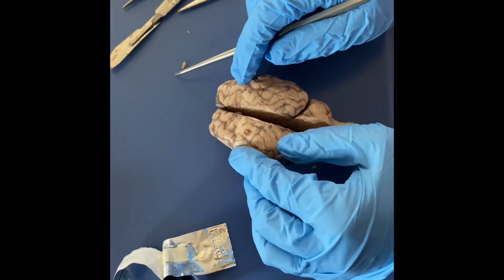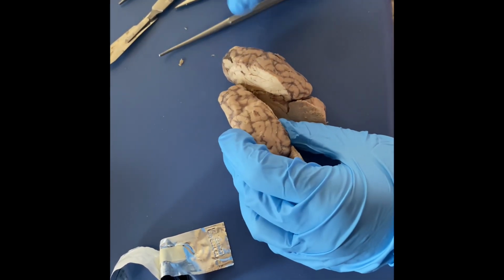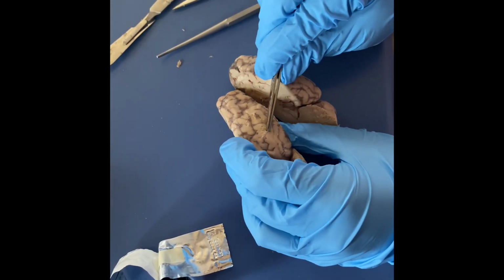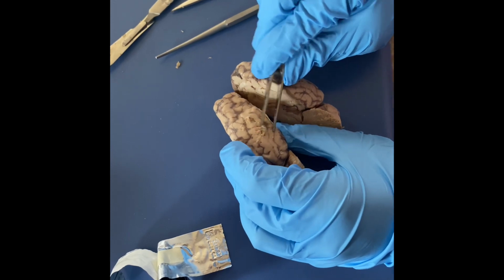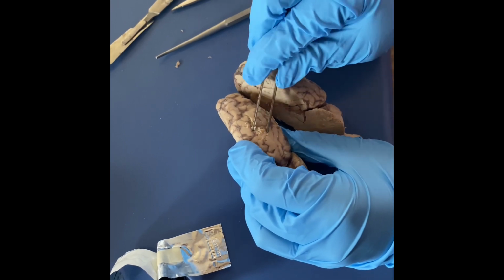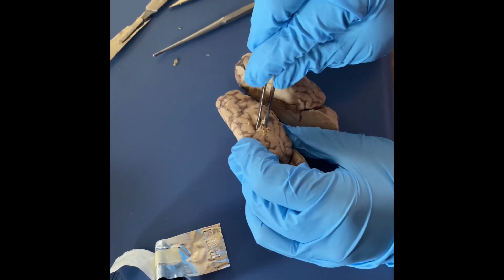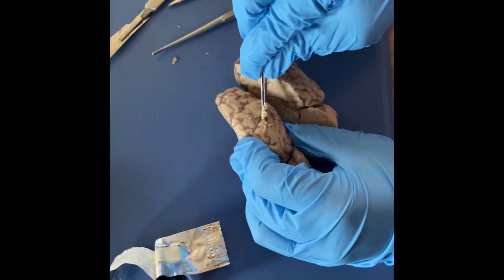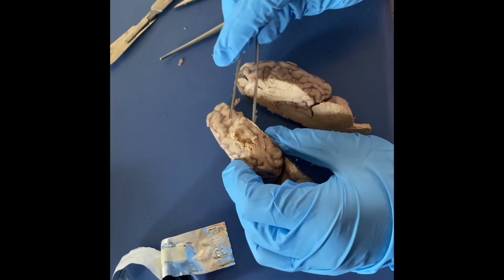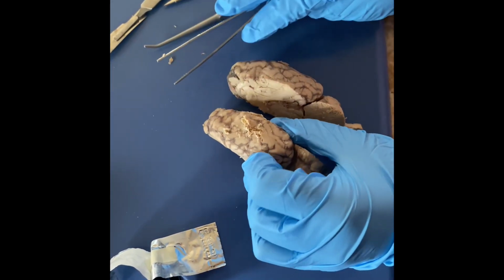And then there's different layers of the cortex. So the first is the dura, which is the outer layer. And the dura you can take off, and you see it's kind of peeling. And then the middle layer is the arachnoid layer, which is supposed to look kind of like a spider web, but it's hard to get at. It's going to be the one in the middle, like that. And then the pia mater is the innermost layer in the brain, and that's the one that's actually touching the inner part of the brain.